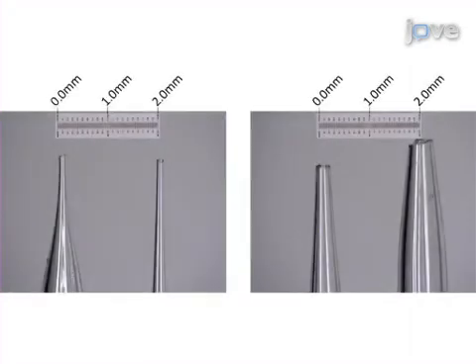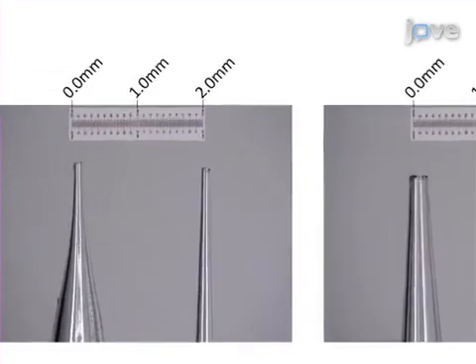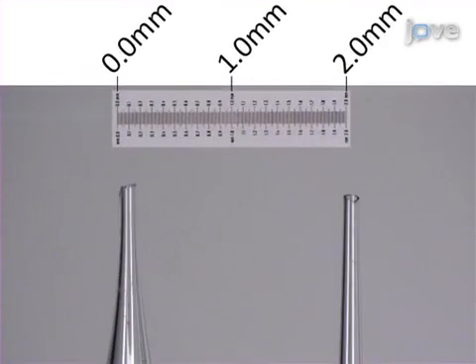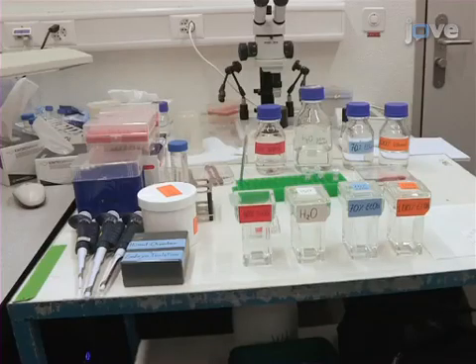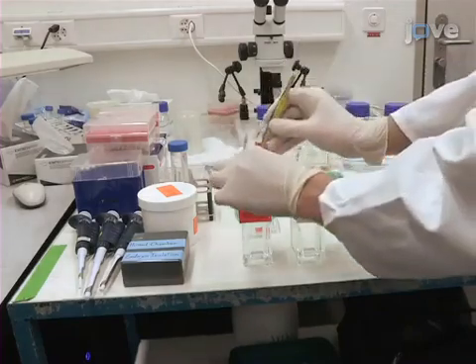To begin, select the best shaped capillaries under a stereo microscope that were previously siliconized, pulled, and cut as described in the text protocol. The opening should be smooth and around 50 to 100 microns. Next, wash the siliconized multi-well glass microscope slides in coplin jars for 10 minutes in 10% SDS.